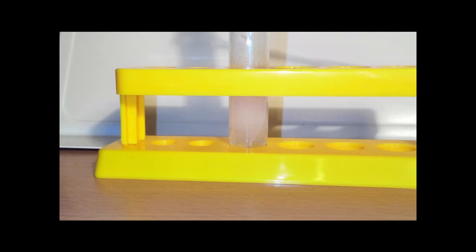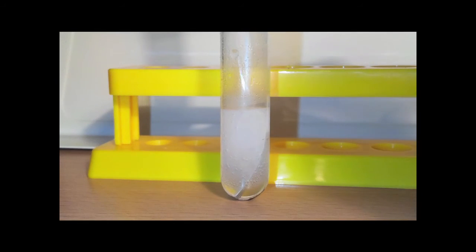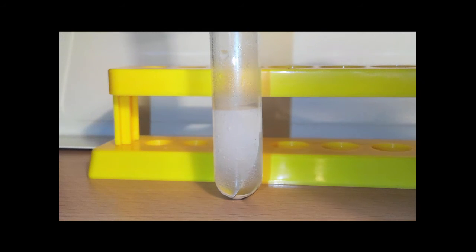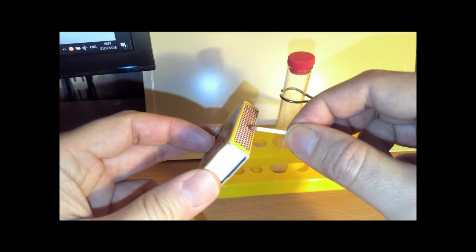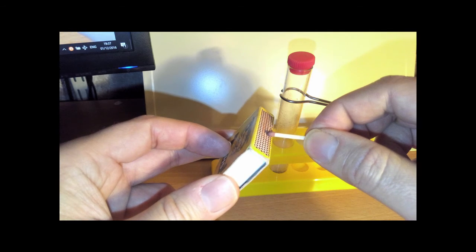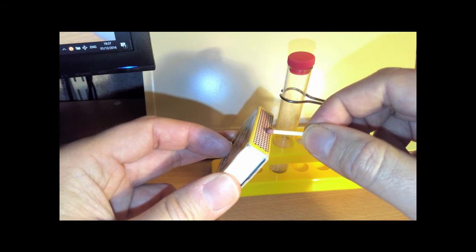Finally, there is the ability using a match to light the hydrogen that has been stored.